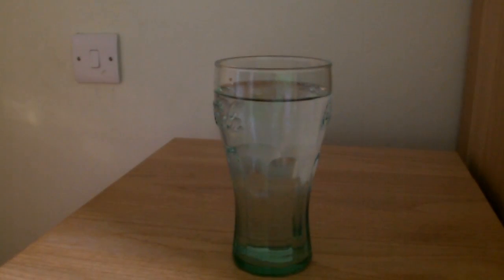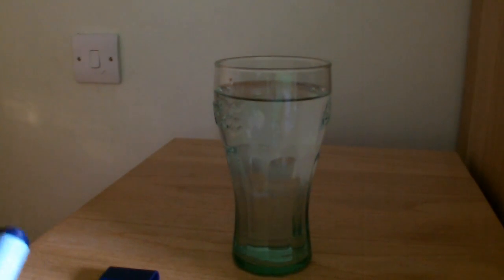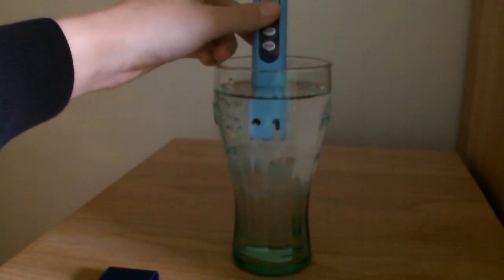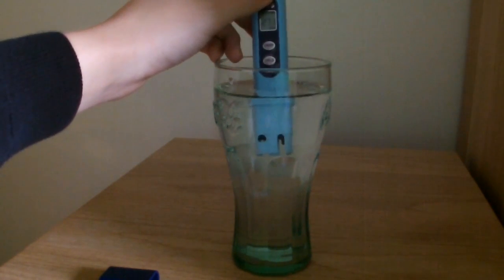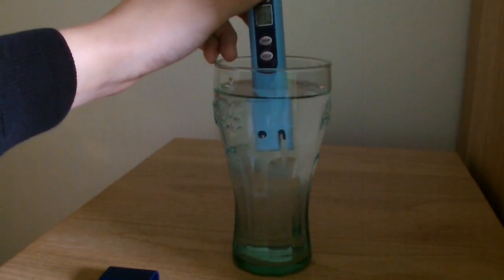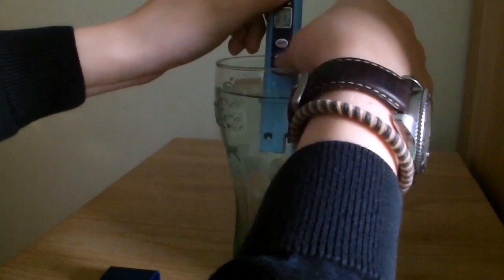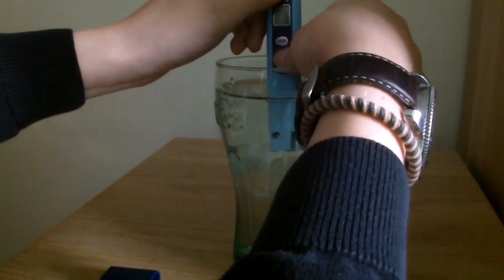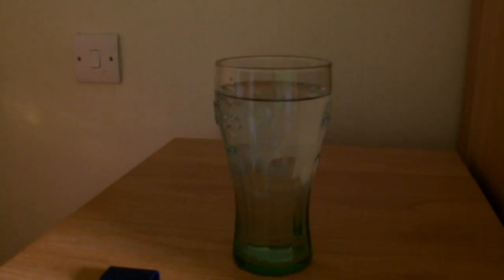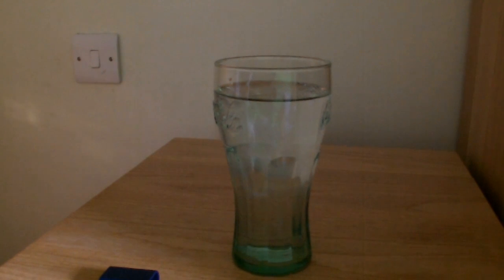If you're interested feel free to watch, if not absolutely no problem. I've got a glass of water here. First, press on and off — it'll equalize to zero. You hold it in here for about 10 to 20 seconds and you press hold. 276 parts per million — so that's just normal water upstairs.